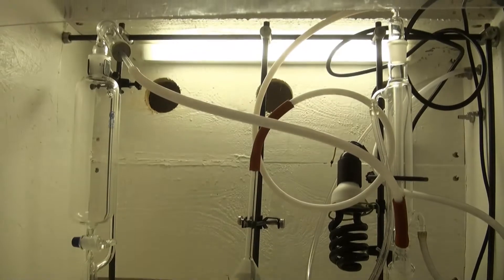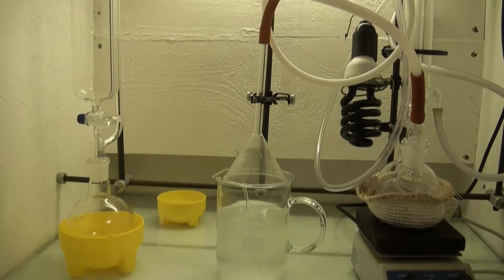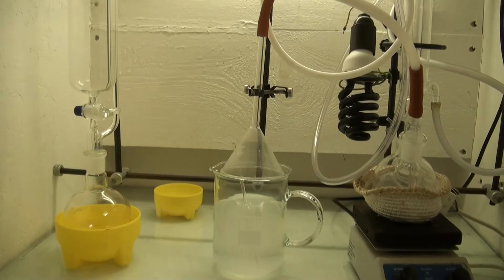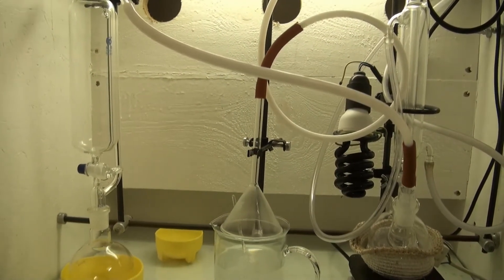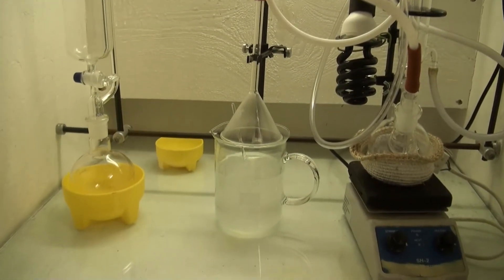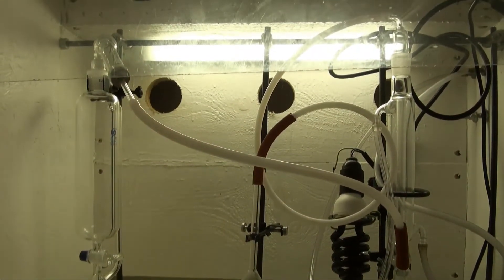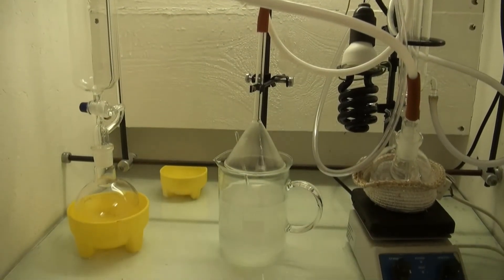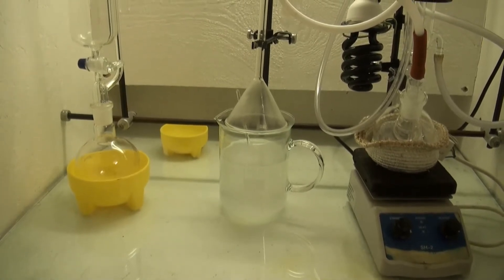For the first chlorination, I set up a TCCA and hydrochloric acid chlorine generator. I used a one to one molar ratio of chlorine to toluene, which should produce mainly benzyl chloride, and I was doing this on a one molar scale. The chlorine was led into a round bottom flask in which the toluene was added later. A condenser was connected to the flask in order to keep the toluene at reflux. The black light was placed close to the flask in order to irradiate the toluene.